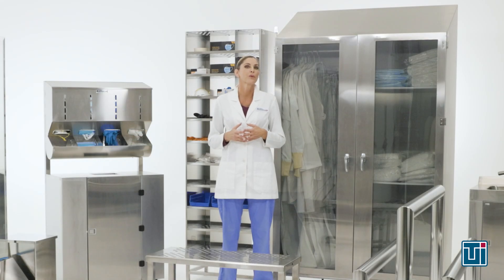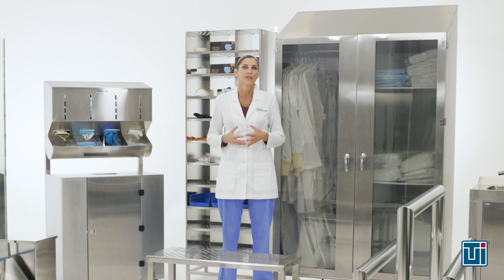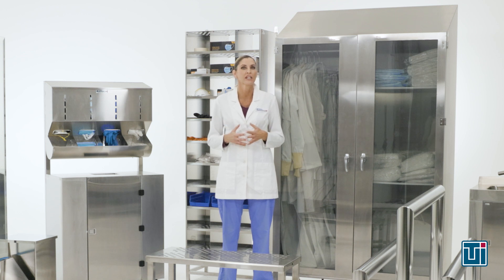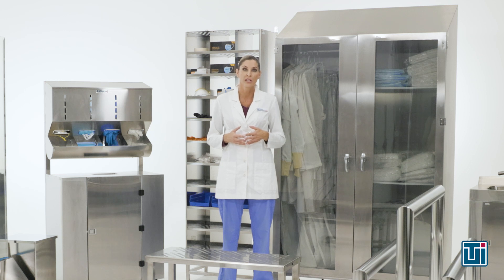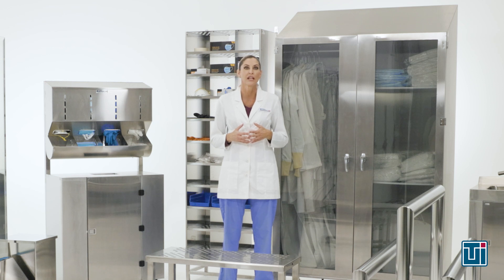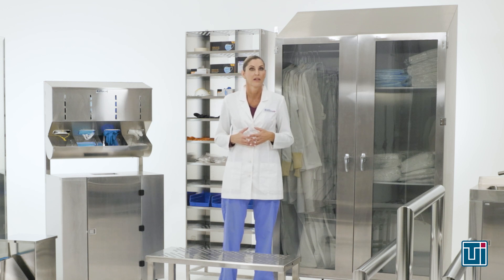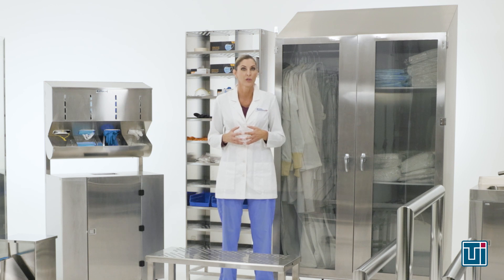However, the most common source of clean room contamination is improper gowning procedures. We carry particles on our skin, in our hair, and on our clothing. Wearing unsuitable attire or skipping steps in the gowning process can quickly lead to contaminated work areas, product failures, or clean room shutdowns. The first step in this process involves identifying and sourcing the appropriate garments.